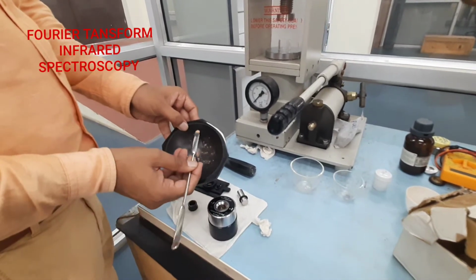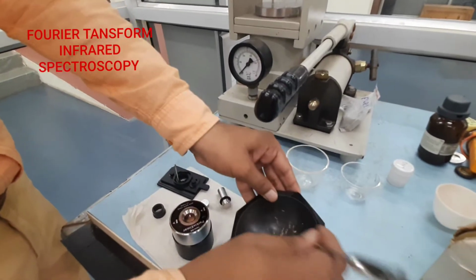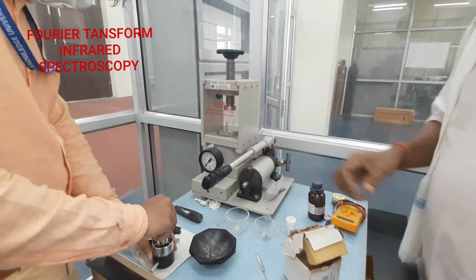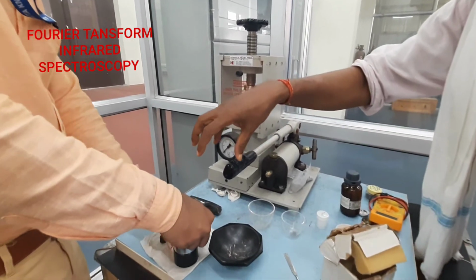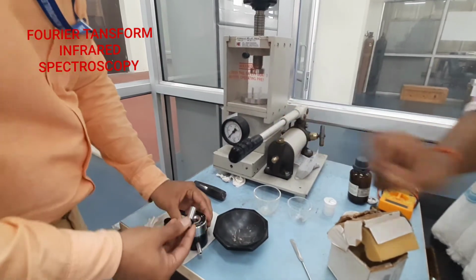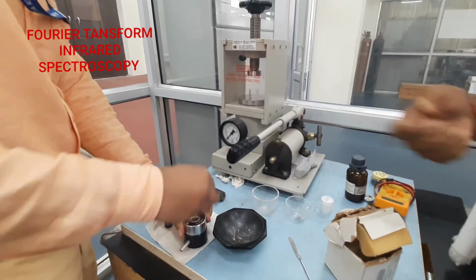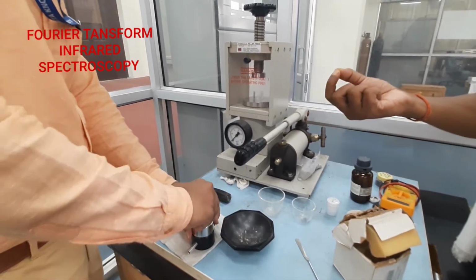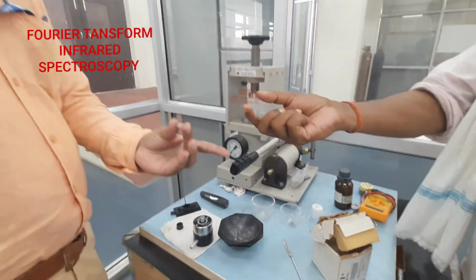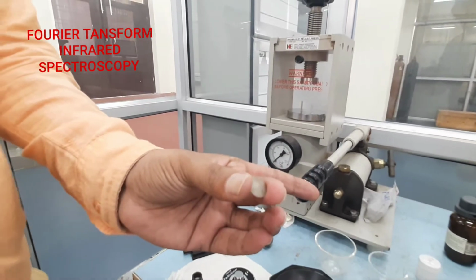Now this KBr mixed powder is being inserted in this device, and you apply some mechanical pressure on this, and we obtain a pellet. Yes, this is the pellet-like material we form.